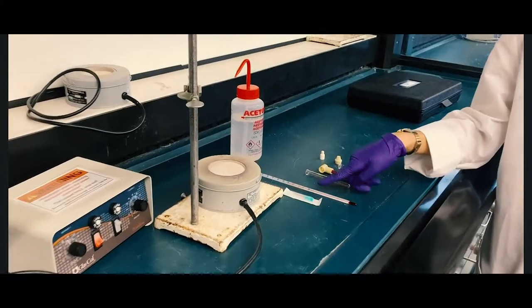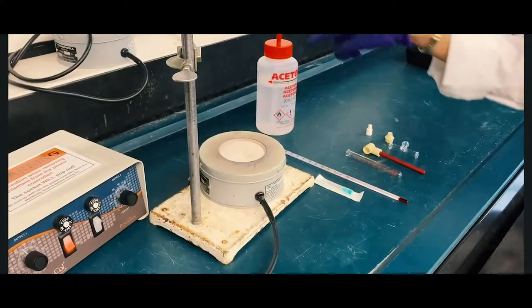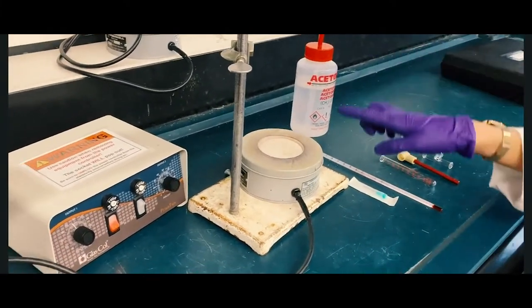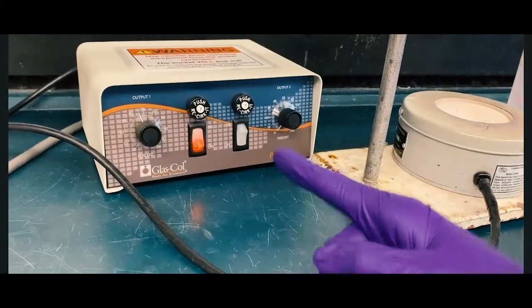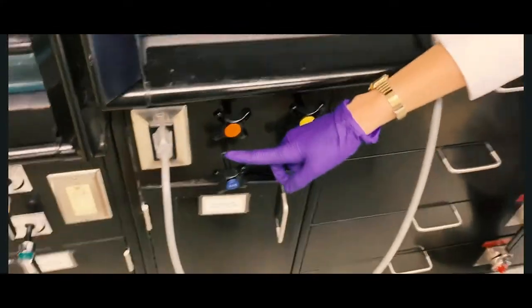You also need a thermometer, a needle, your liquid sample, a sand bath, which is plugged into this adapter at 45 to 50%, and that is plugged into this adapter.